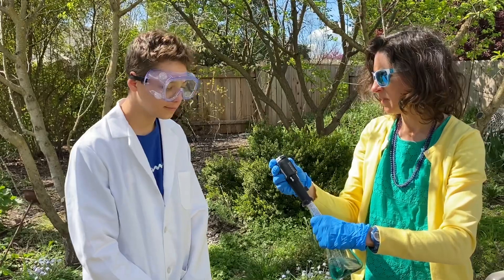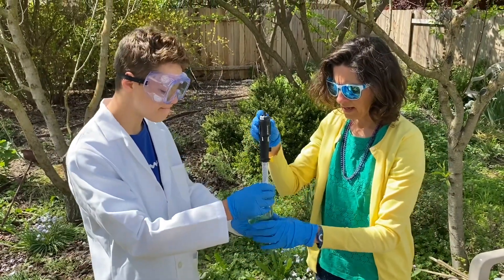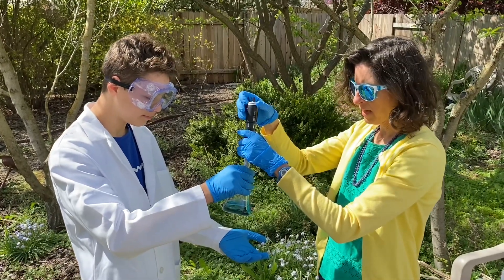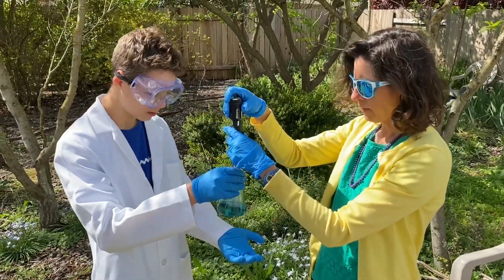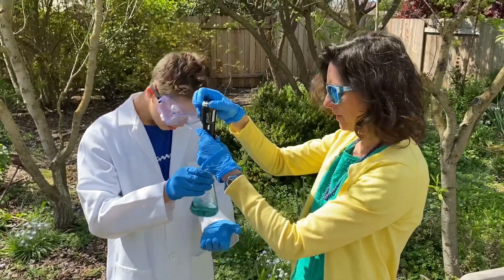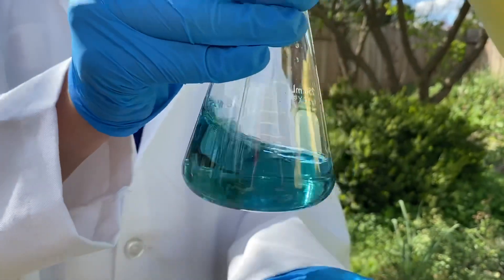Eli, do you want to turn the dial or do you want to swirl? Swirl. Okay, so take the flask — hold it and tilt it a little bit so I can keep the J hook in, and then you're going to swirl it after I add some drops. I'm going to add a few because I know that we're going to need a bunch, and then go ahead and swirl it. Keep swirling — I'm going to use my coat as the background. Oh shoot, did I go too far? Look, it's starting to change color a little bit, so now I've got to be careful and just do one at a time.